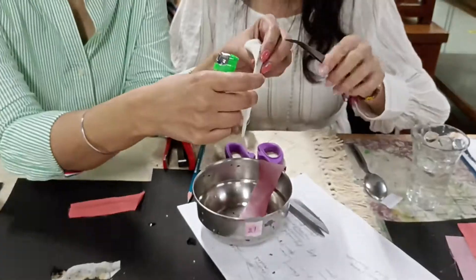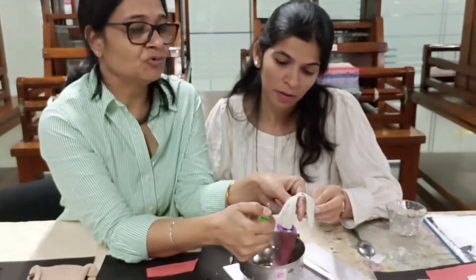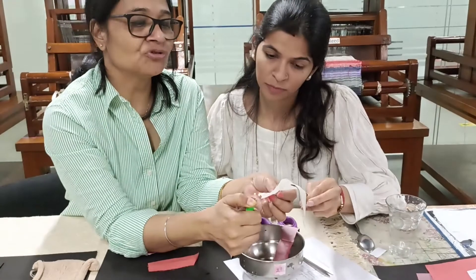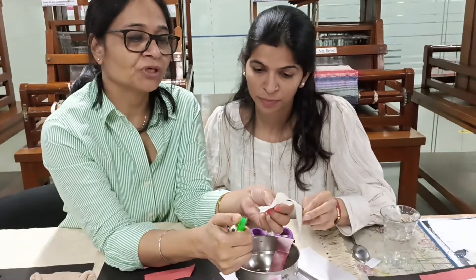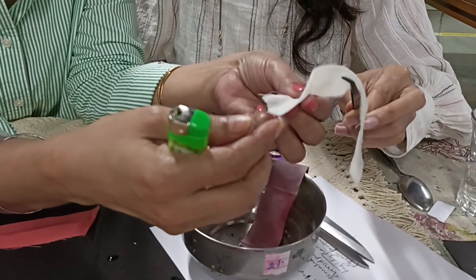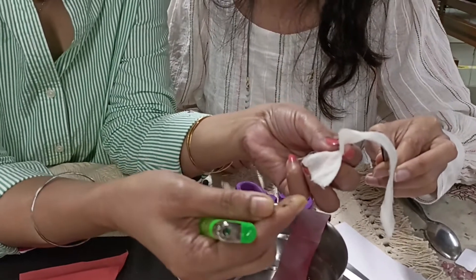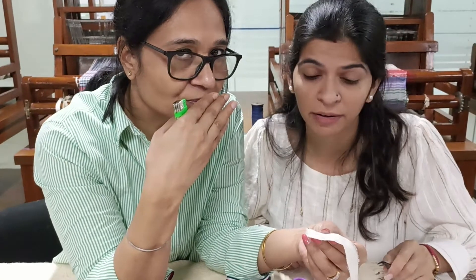The same burning behaviour will be seen with wool fabric also. Wool and silk are self-extinguishing — once the source of flame is removed, it automatically extinguishes on its own. This is the reason why people say that if a person is on fire, put a blanket on them — in olden days, blankets were made of wool. The ash formed is also crushable, and it also gives a pungent smell, sometimes similar to that of burning hair.